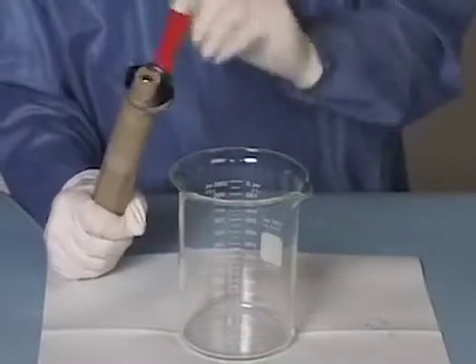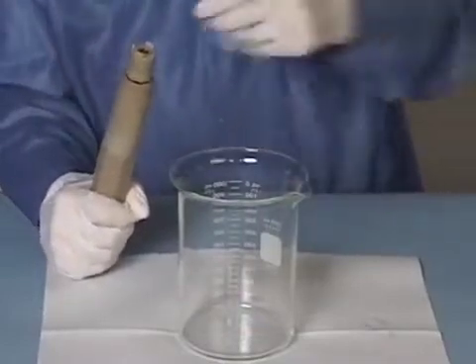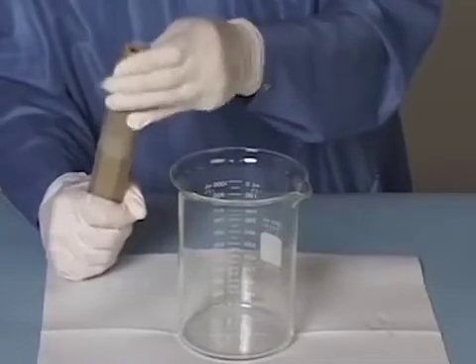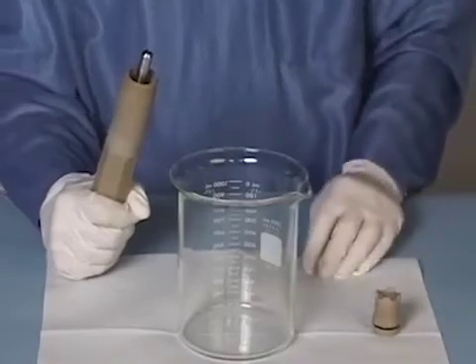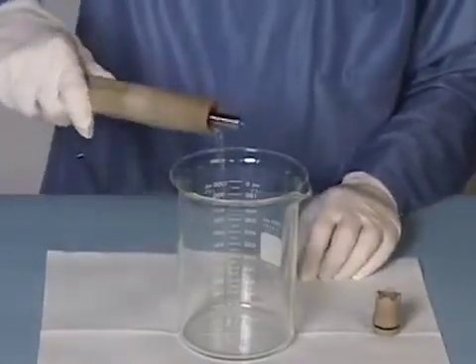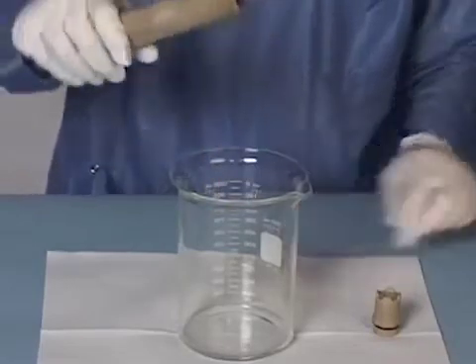Next, use the wrench to loosen the salt bridge, gently turning counter-clockwise. At this point, you can use your hand to fully loosen and remove the salt bridge. Pour out the old solution — this is a non-hazardous, pH-neutral solution that can ultimately be discarded down the drain.